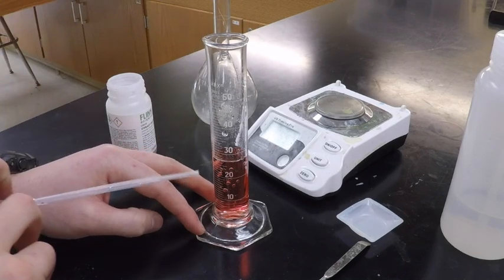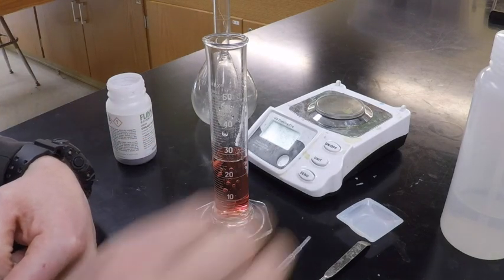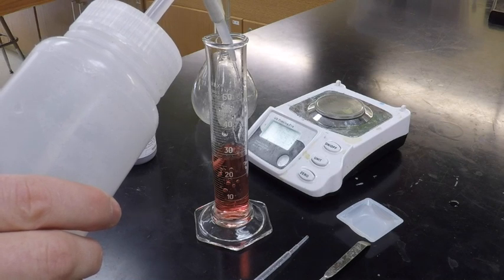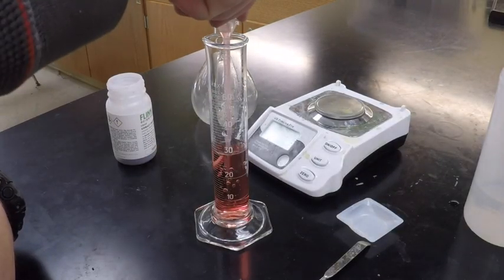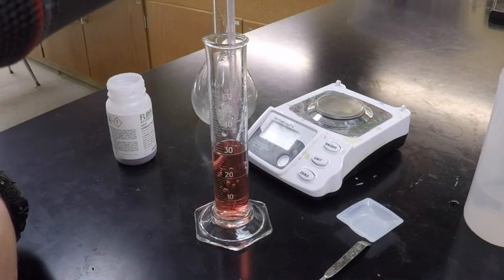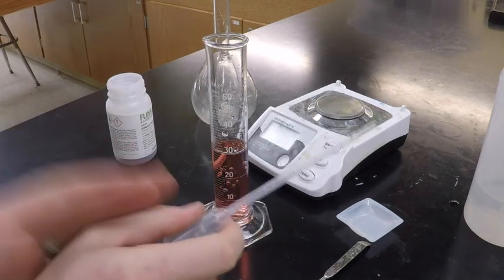So now I haven't gotten quite to 30 milliliters yet. I'm at like 27 milliliters. So what I need to do is come back over here and add a few more milliliters to get that up to 30. There we go. Now I got it to 30 milliliters. And not all of it has dissolved quite yet, so I'm going to try and get all that to dissolve. Now, it looks like it's about all dissolved. So now here's what I have.